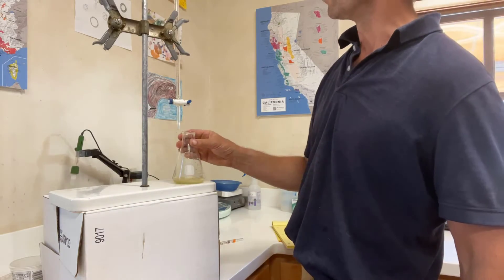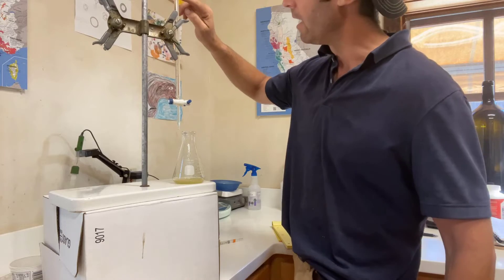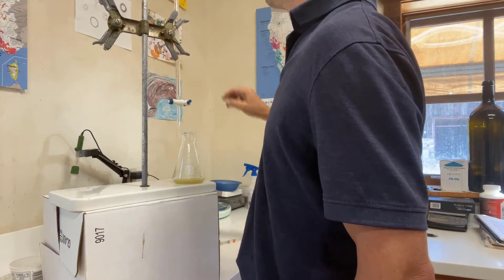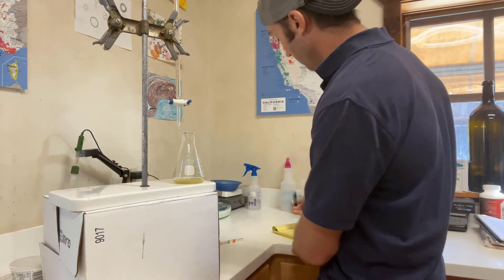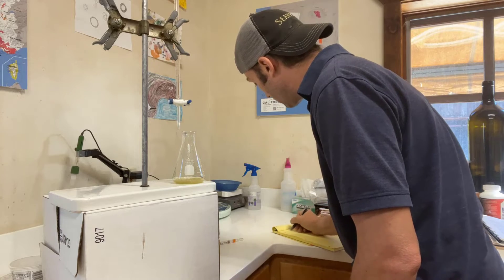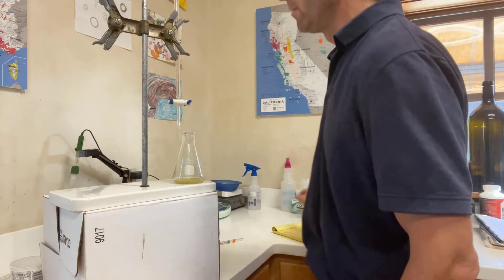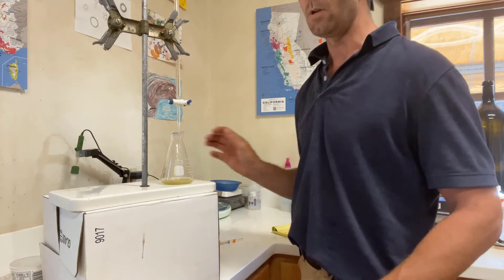Okay. So come up here to the burette and we are starting at 10.5 milliliters. Make sure to write that down. That's the one thing I mess up the most, forgetting to write that down.